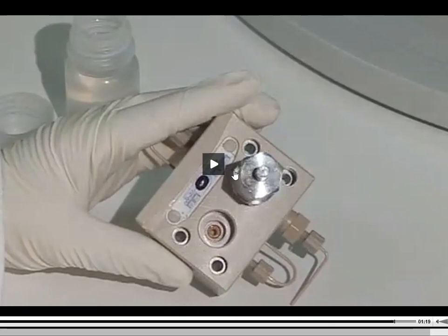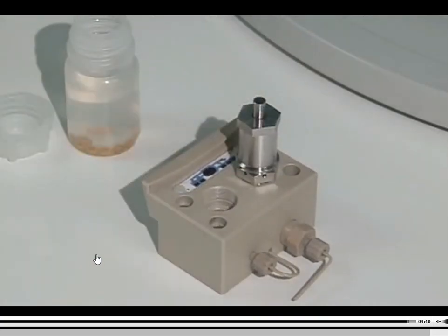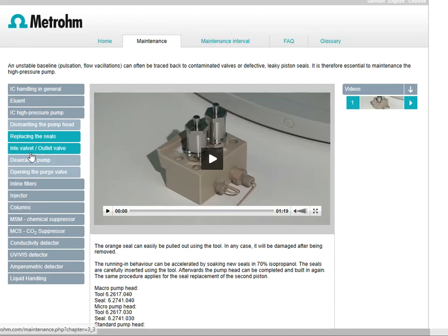So as long as you've got the specialized tools to guide you into those areas to replace those seals, you don't have to worry about, did I put it in there the right way? Do I have enough force on it? This process is pretty easy, and anyone can basically do it. So don't pay thousands of dollars for someone to come out and do this job for you. All right. So that is what we would call replacing the seals on the inside of the pump.